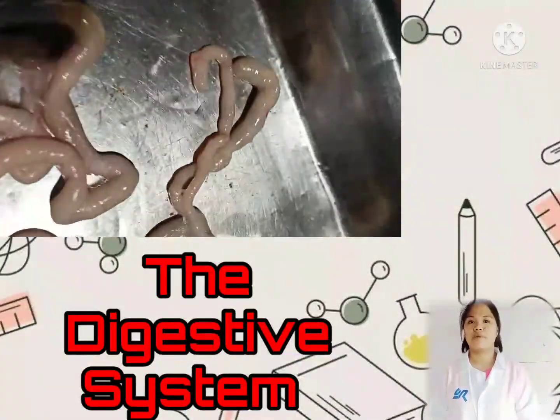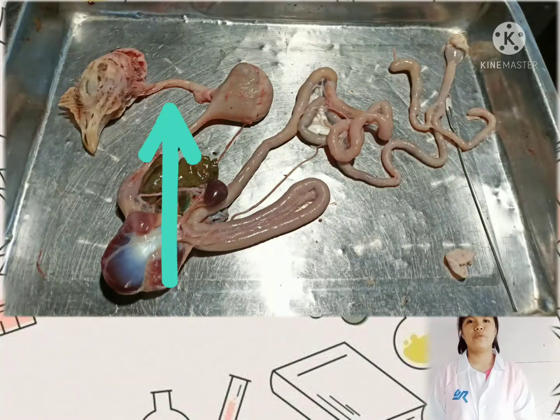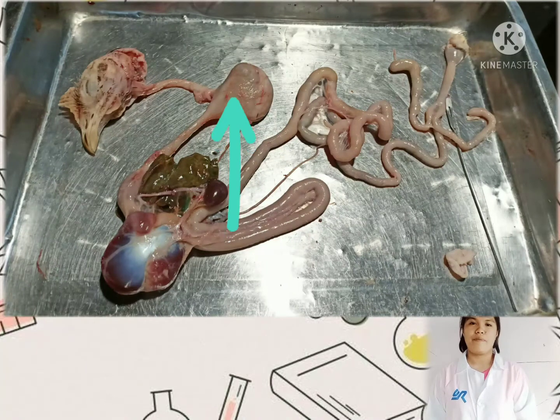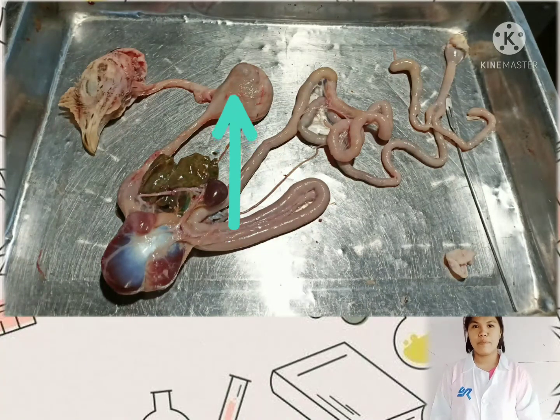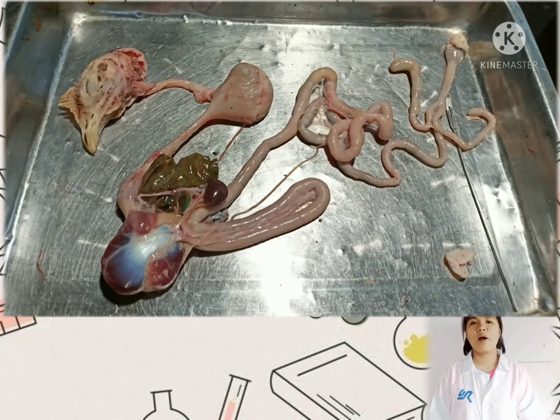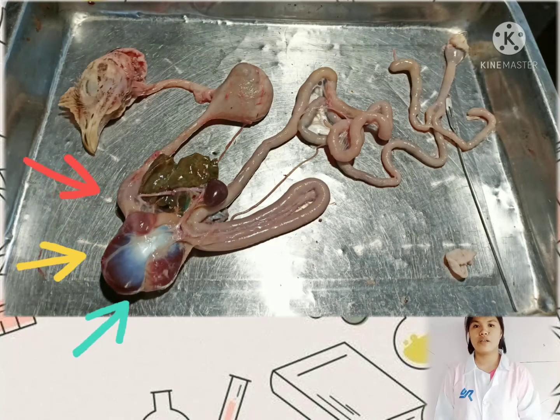Digestive system of a chicken. It all starts in the mouth. The esophagus transports food from the mouth to the stomach. And the next one is the crop, a pouch in the esophagus used to store food temporarily before moving it on to the stomach. And then the stomach area. The stomach area has 2 parts, the proventriculus and the gizzard.